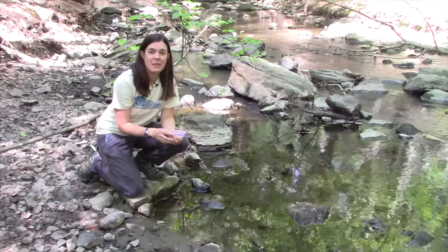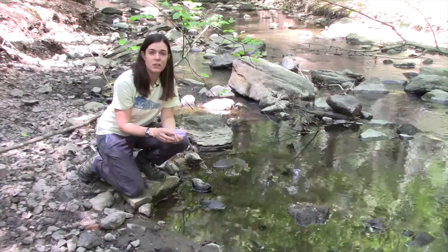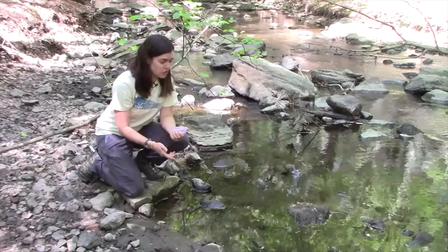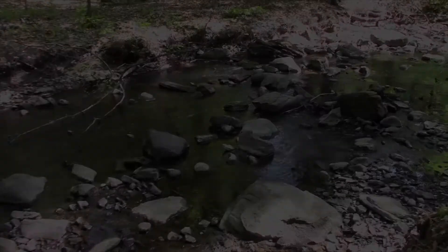Hi everybody, my name is Caroline Blake and I work for Lake Champlain Sea Grant as well as UVM Extension. We're here at the streamside today to continue the chemical quality testing.